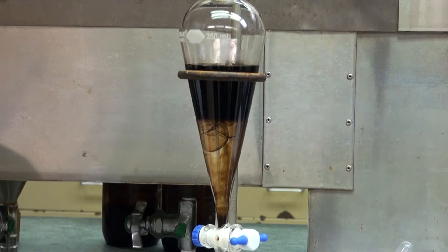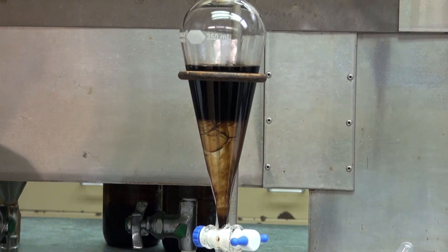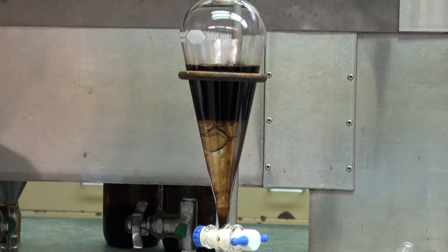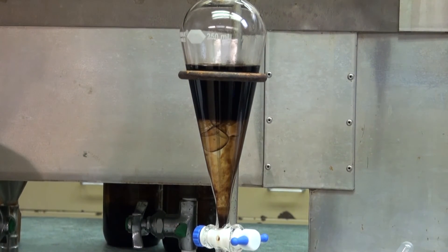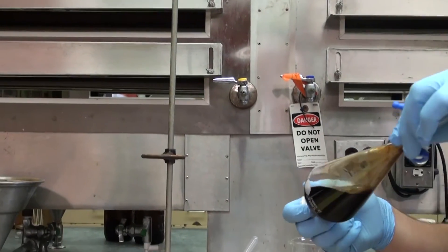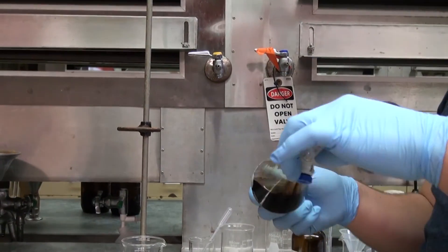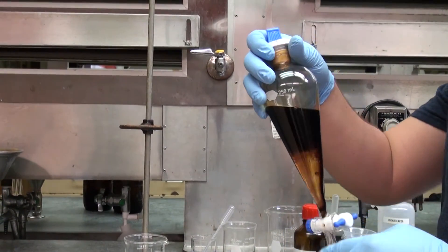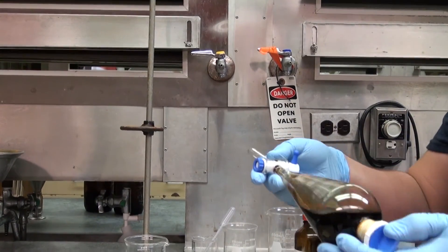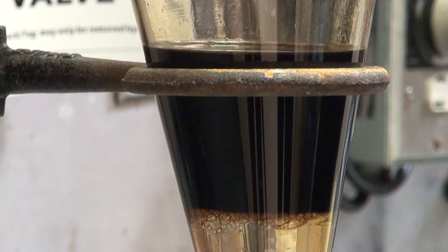Some solutions tend to build emulsions while being extracted. That will be the case in the experiment of the extraction of caffeine from tea with dichloromethane. In this case, you don't shake the separatory funnel vigorously. Start with rocking motions and keep doing that for five minutes.